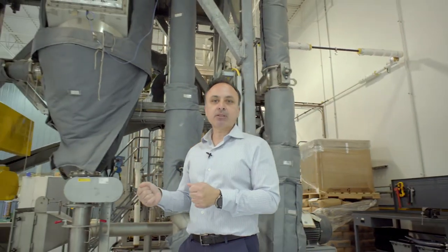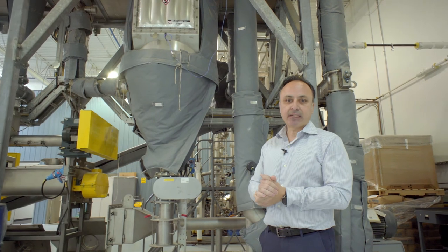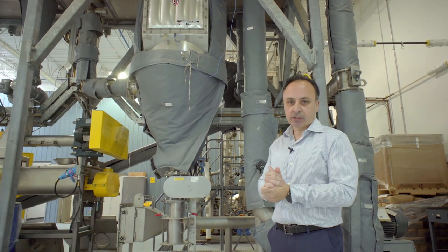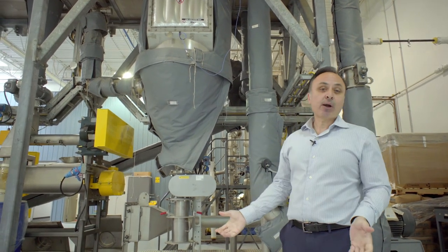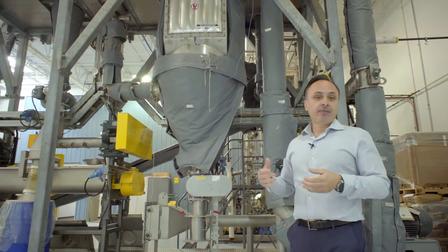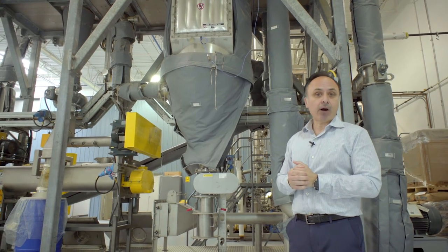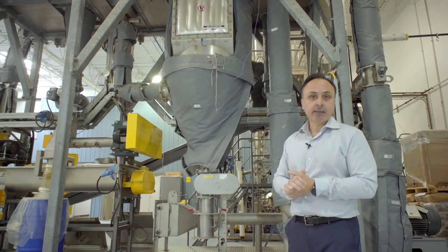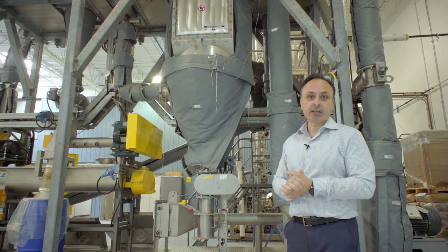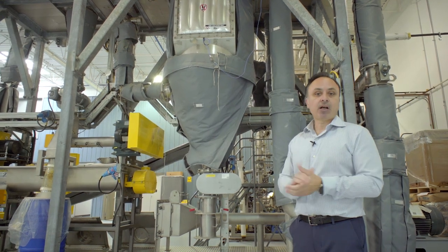When customers are drying thermally sensitive products, this can be a very advantageous solution. This was a quick overview of the system. Feel free to contact us if you have drying inquiries which require ring drying as a solution. Thank you very much, and I wish you all a pleasant day.